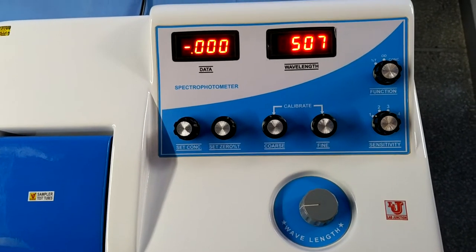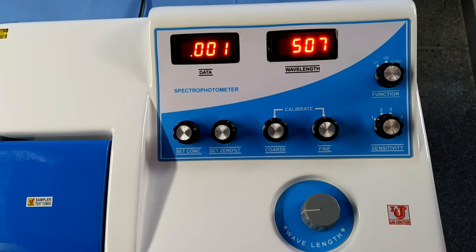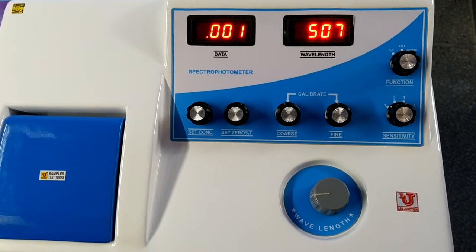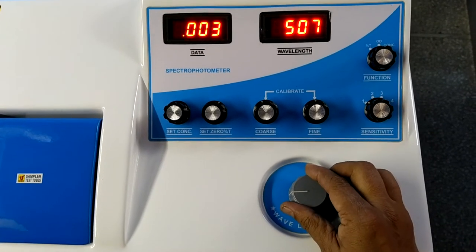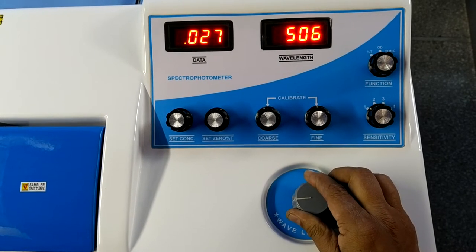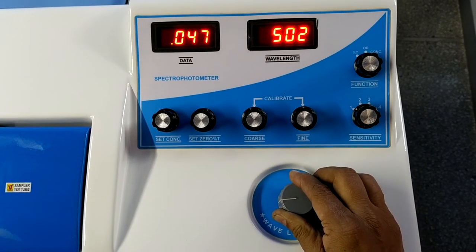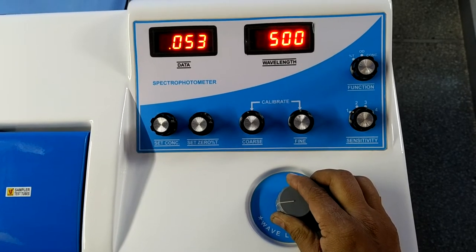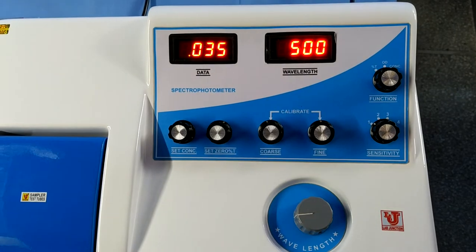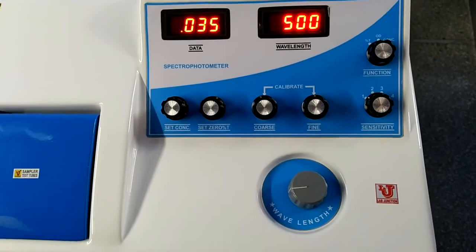Now, how could we use the spectrophotometer? Suppose your wavelength is 500nm — I am adjusting the wavelength to 500. You set 500nm from the wavelength knob.